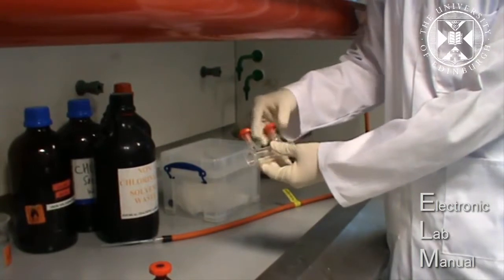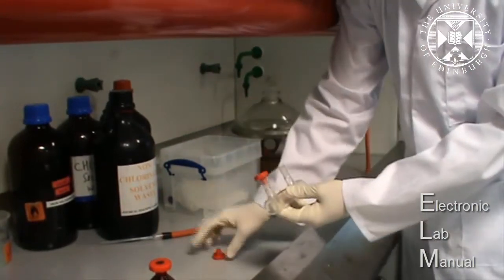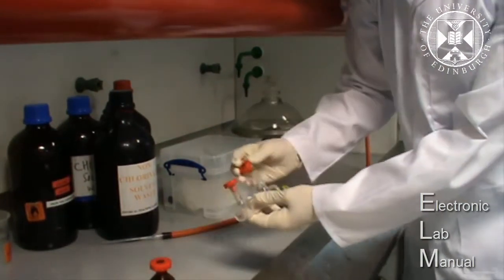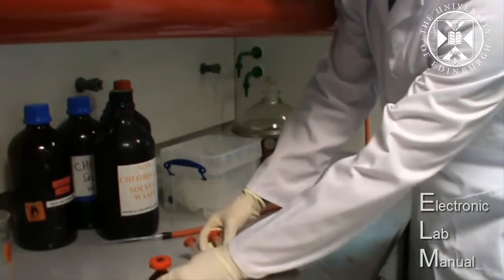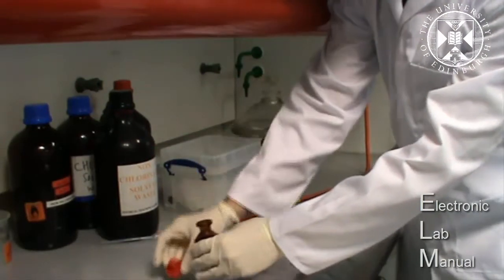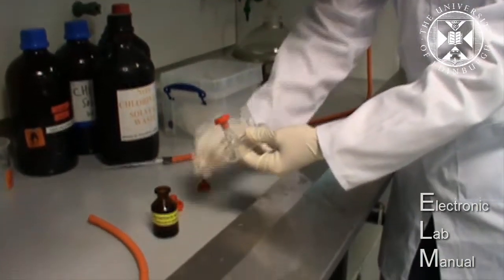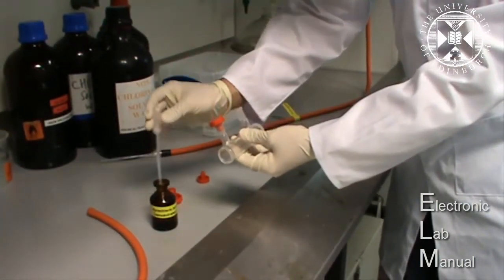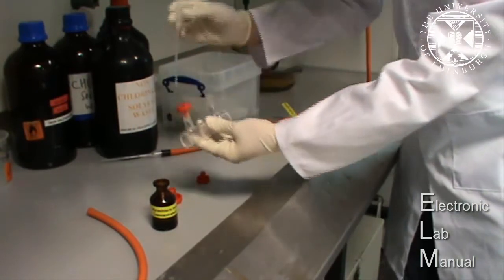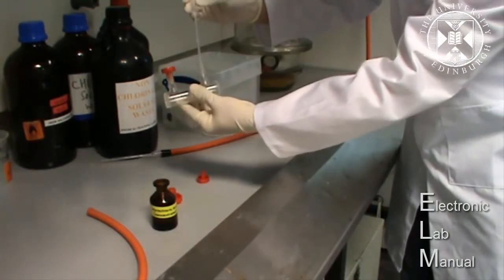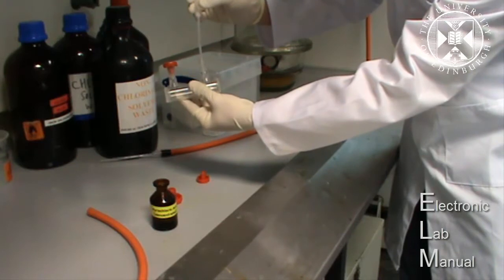So once you've done this, wait a few minutes, then take some concentrated hydrochloric acid and a dropper and carefully add just a few drops into the cell.